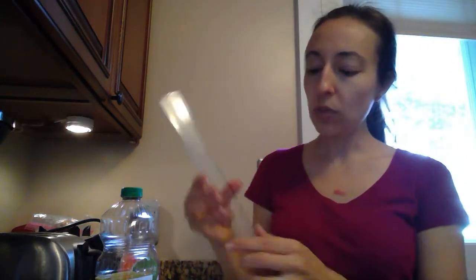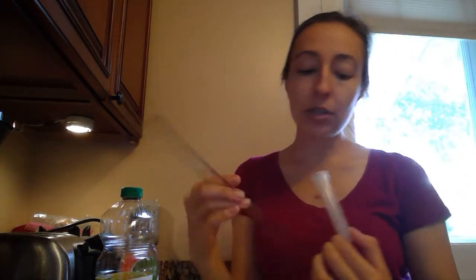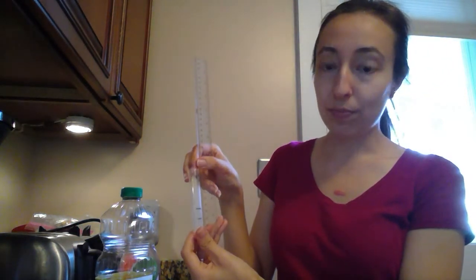And so looking down at the procedure, we're going to look at how lipids react in a couple of different ways. So this is where you need your test tubes. It says you're going to need 2 test tubes. And for this first part, you actually want to take your ruler, looking at the centimeter side, and you want to put a line at 1.5 centimeters and a line at 3 centimeters on each of your test tubes.